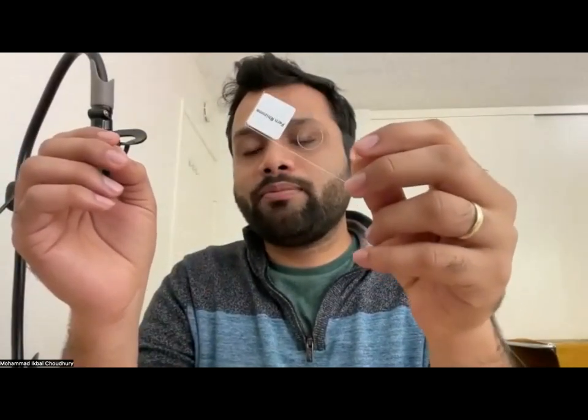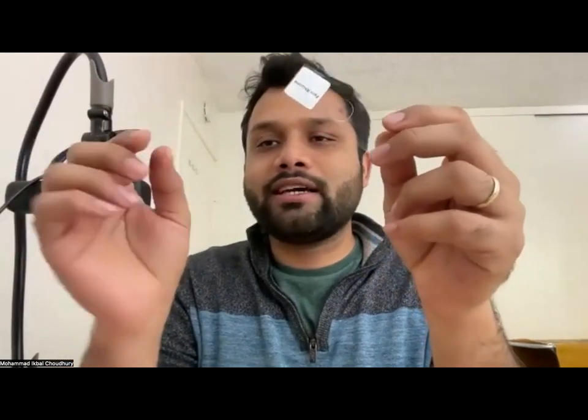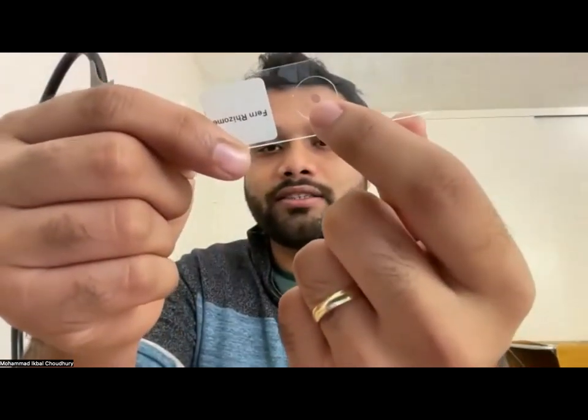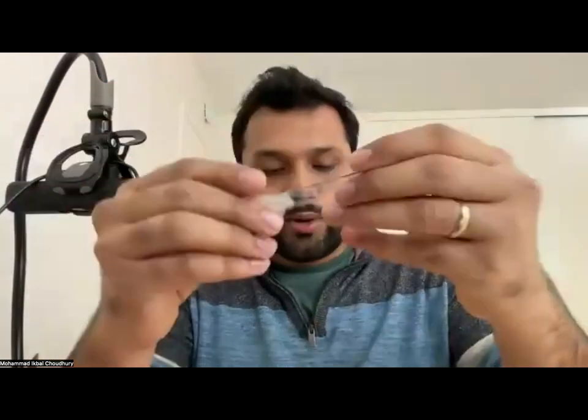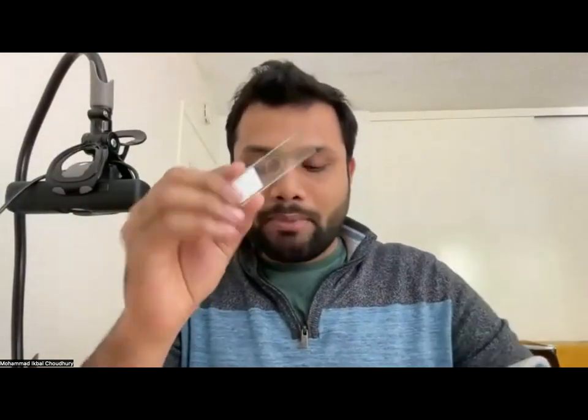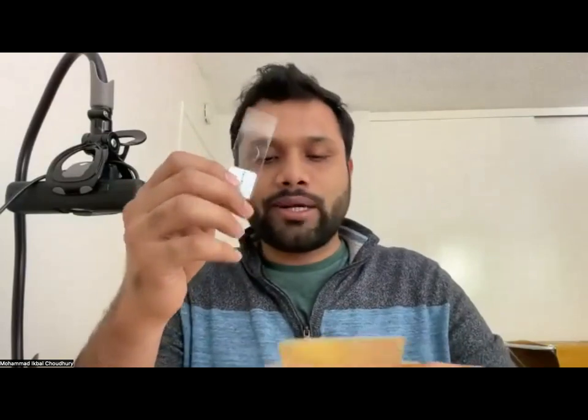So it's basically a cross section of a plant stem. They take a stem, they take a tiny slice of the stem, and they make a slide out of it. So it's sealed completely. You can see that sample right over there. There's a circular sample over here. Okay, now let me just quickly show you how you mount this slide on the microscope.